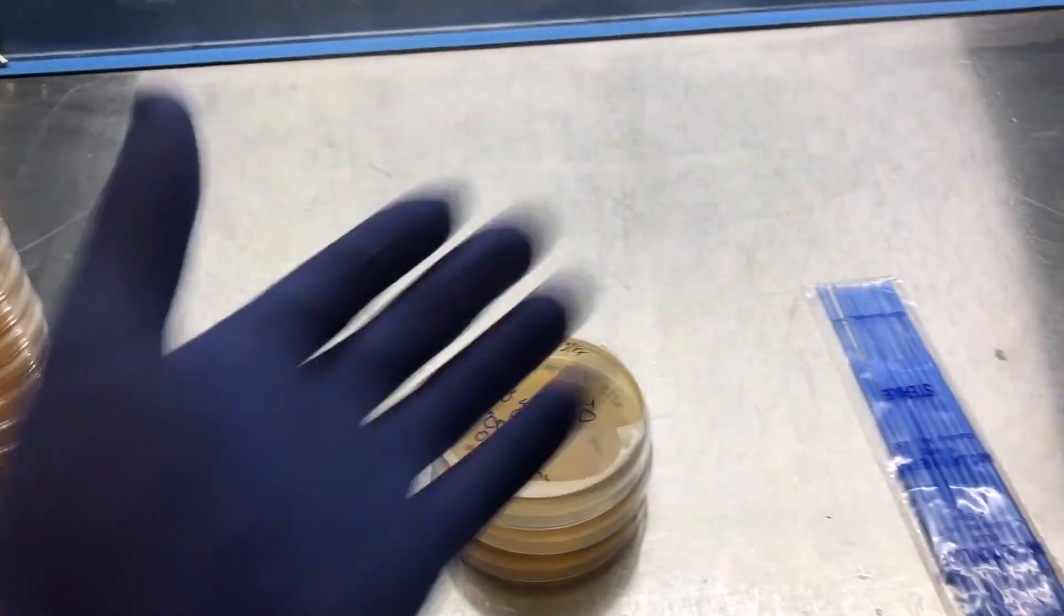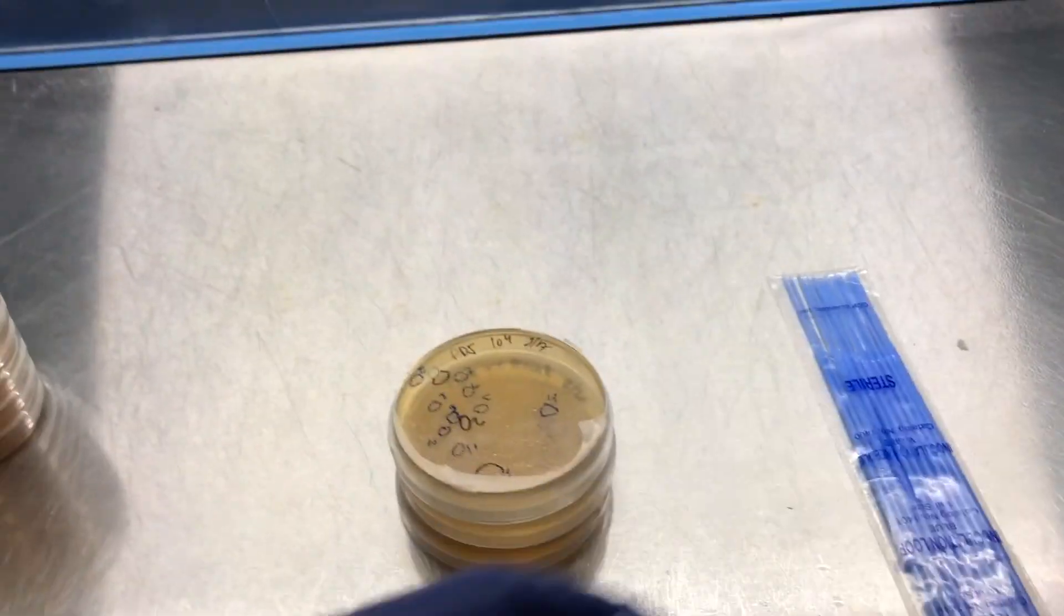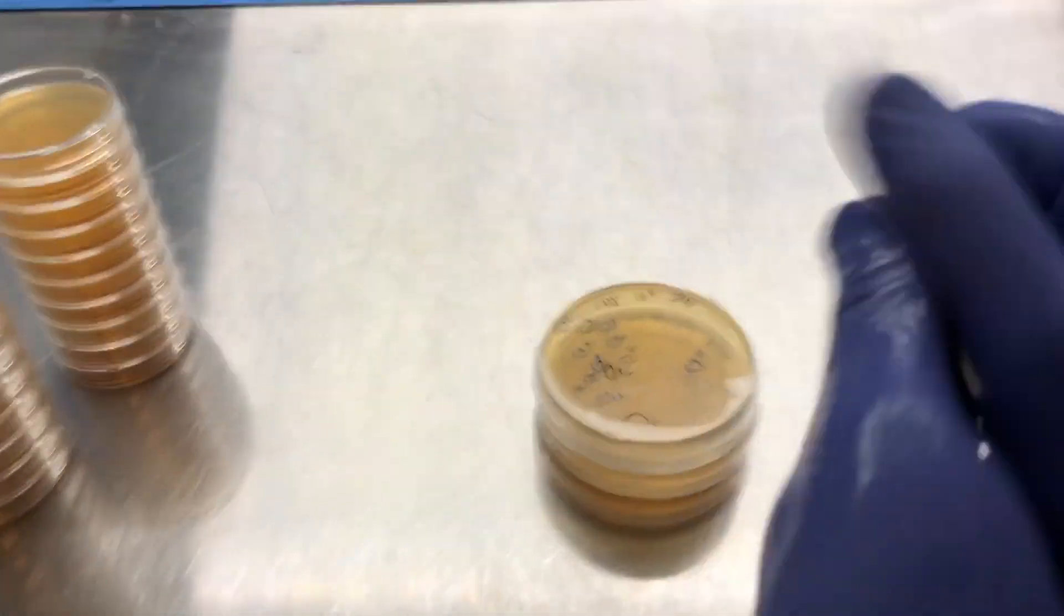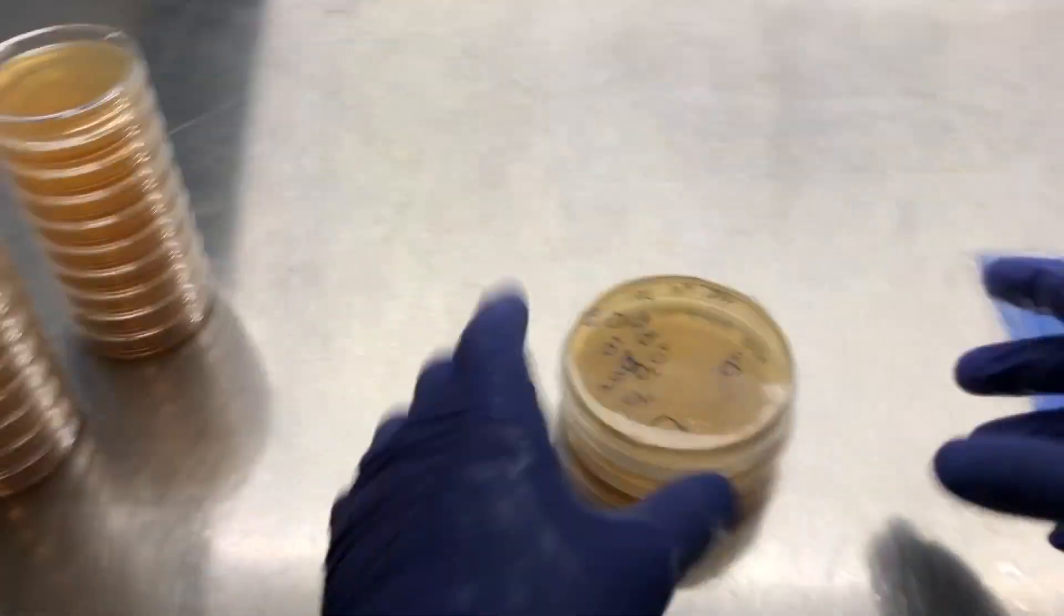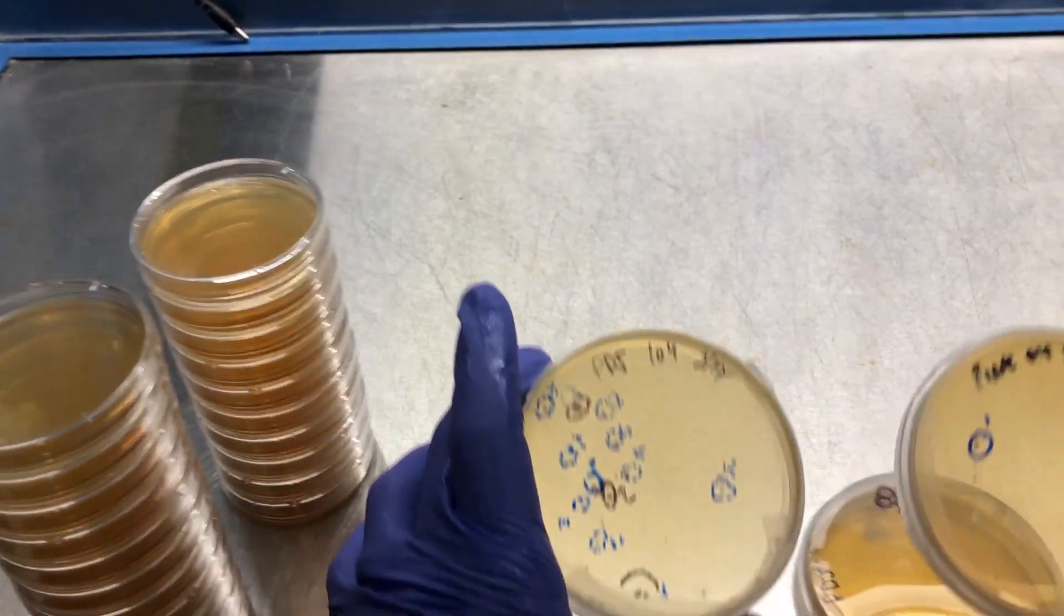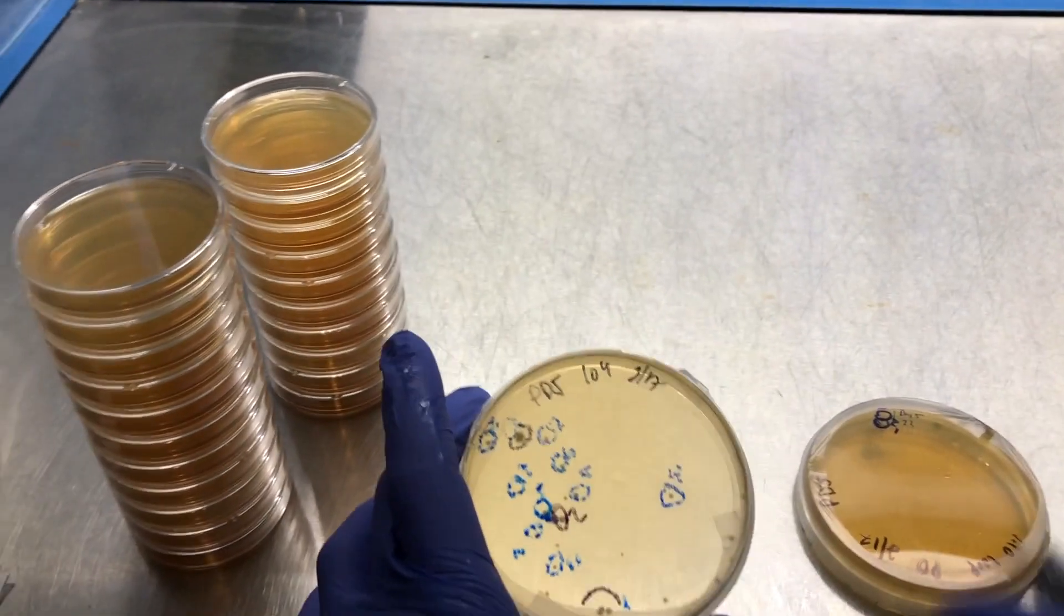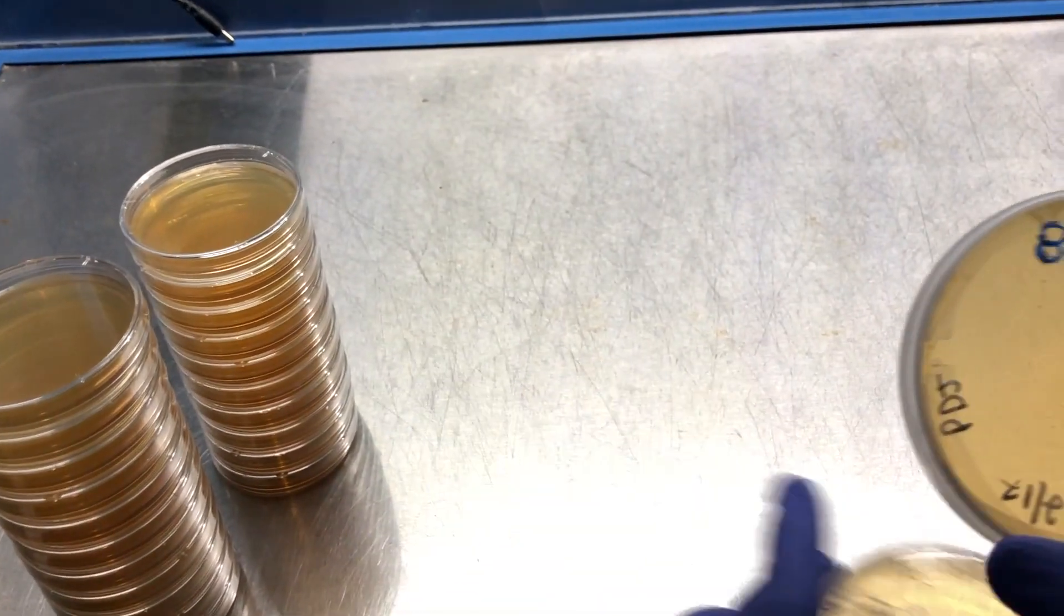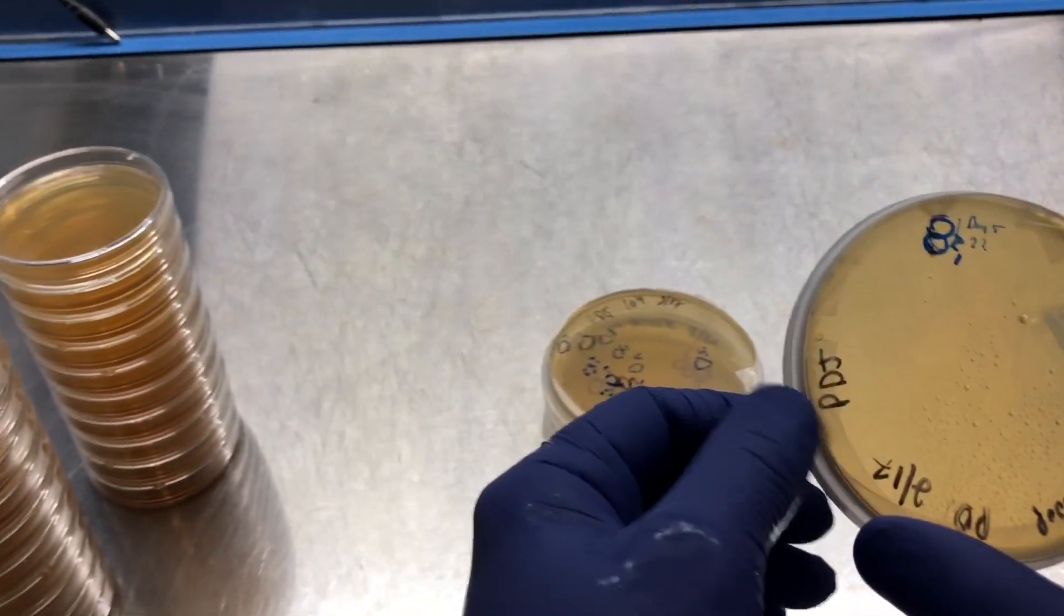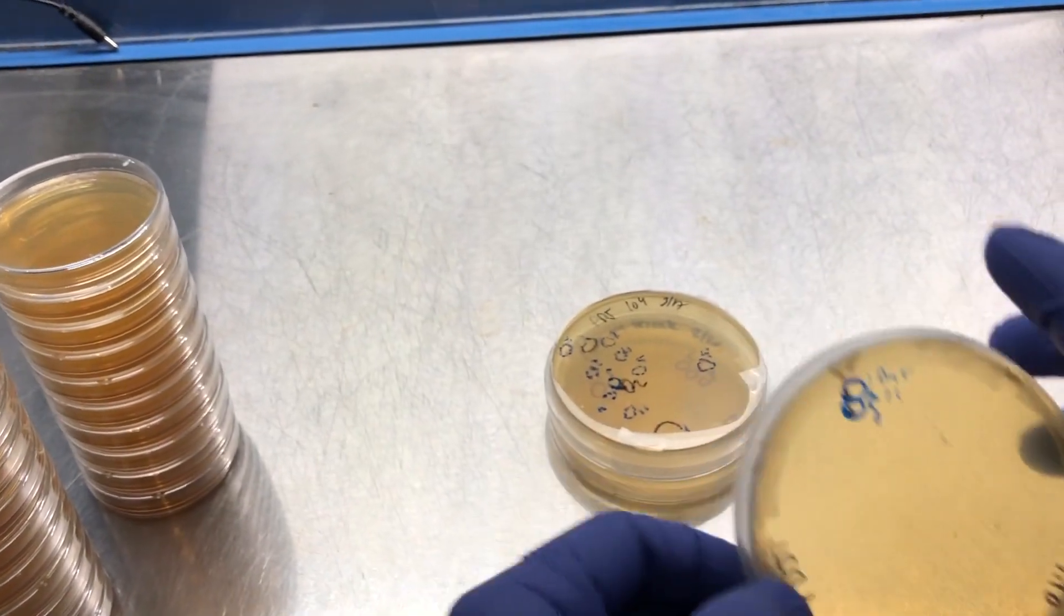All right, so I've got my hood cleaned down and I'm just going to do an extra spritz of alcohol before I get started here. And I'm going to be working with the cleanest plate first, so to me that's going to be this one. It only has a couple colonies up top.